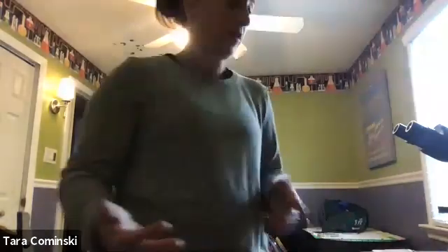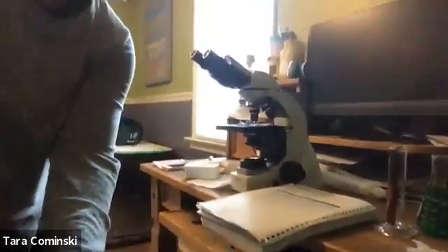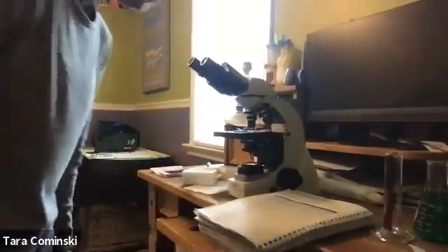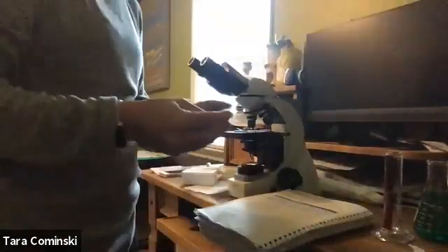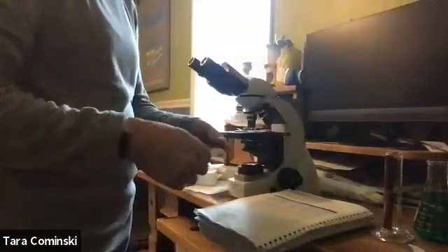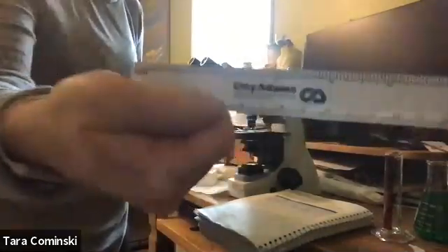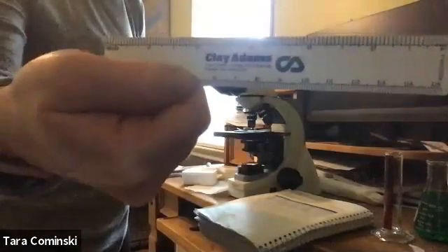As we move through this lab, you're going to be doing conversions, so you're practicing it anyway. Now I'm at the experimental procedure for length, still on page 10. It's asking us to measure something. I don't have a meter stick, but I have this ruler, and I know it's backwards.